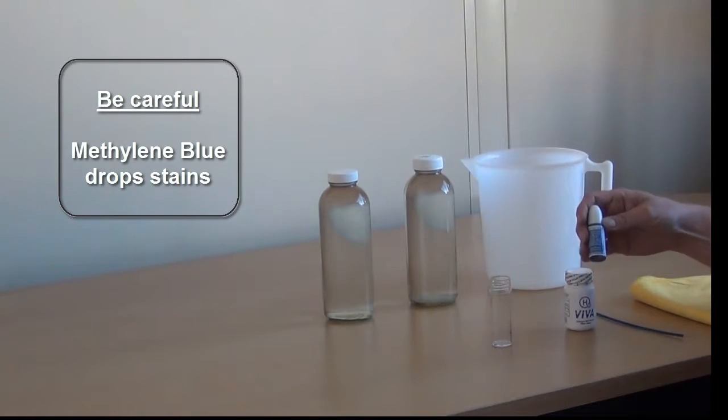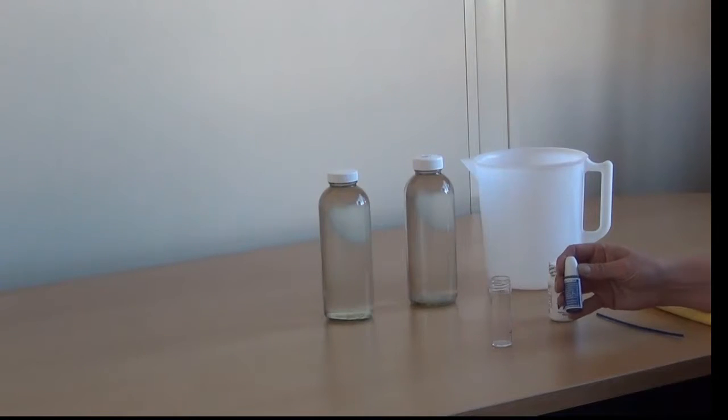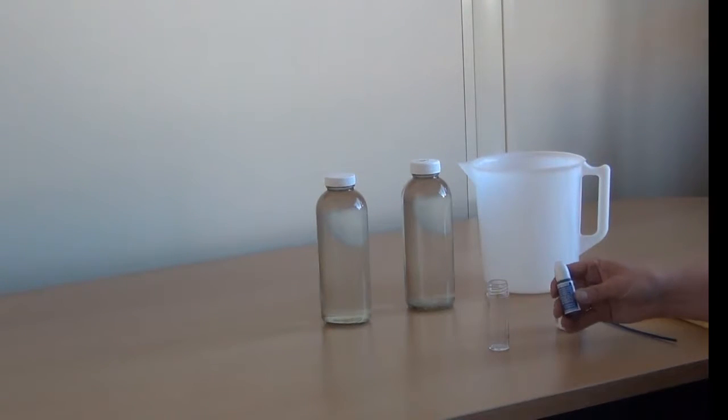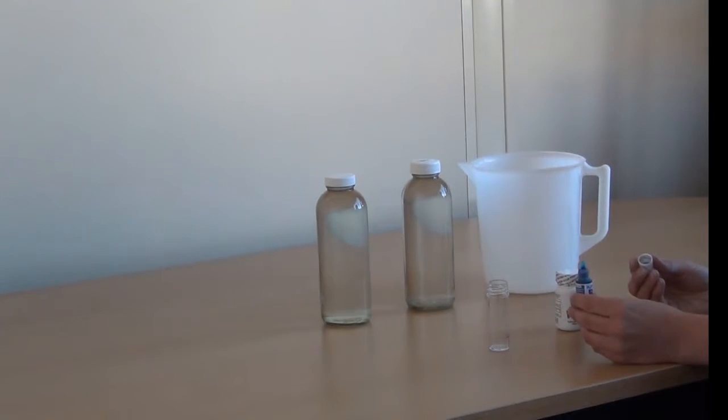When using the drops take care as they can stain very easily. The spout on the hydrogen reagent drops is designed to dispense a precise amount of the reagent.